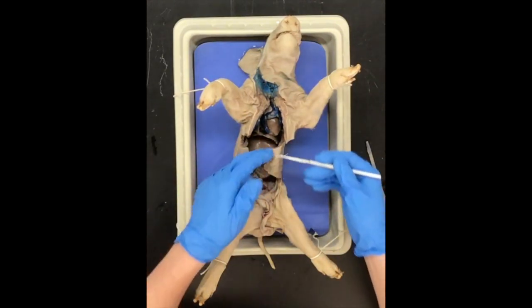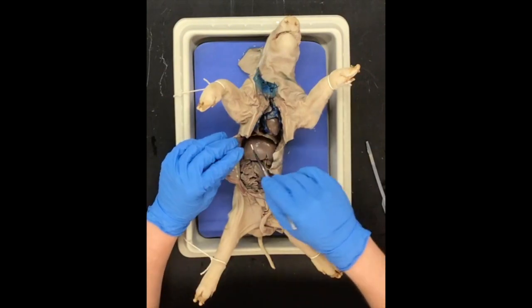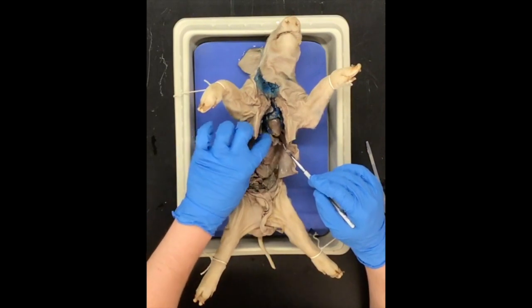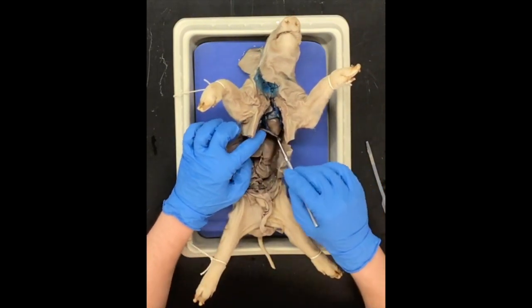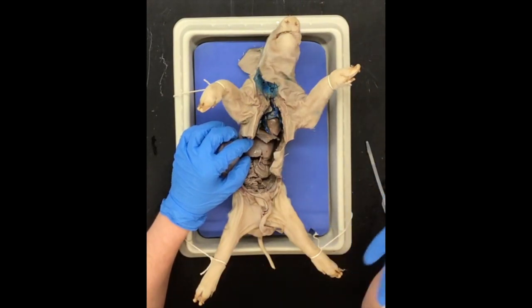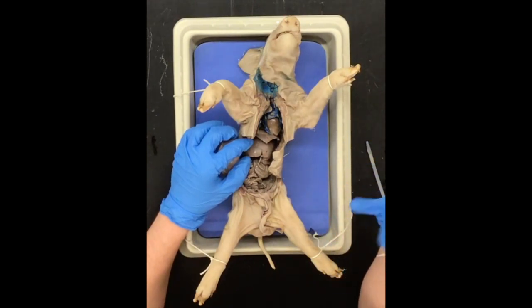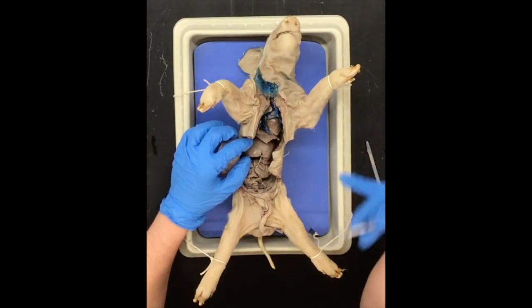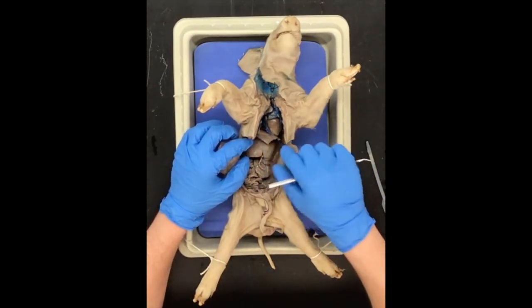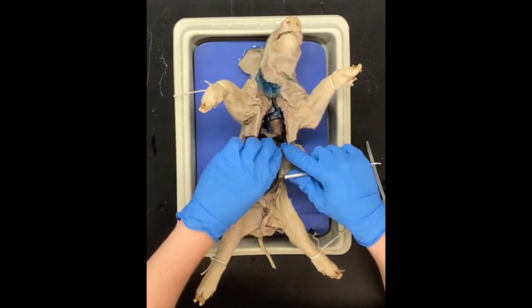Right underneath the diaphragm, now we're getting into the abdominal cavity. In the abdominal cavity, we have this big structure right here — that is the liver. The liver is there for tons and tons of purposes, including detoxifying harmful chemicals and dealing with anything the rest of our body doesn't know how to handle, like fructose metabolism. So there's our liver — it serves tons of purposes and is super big in both the pig and in us.